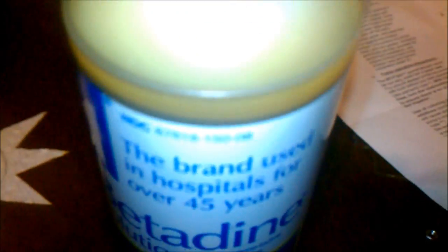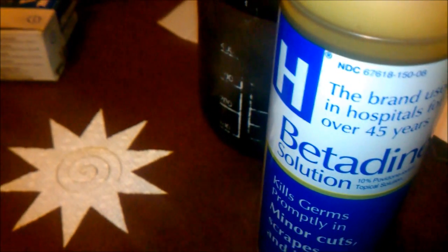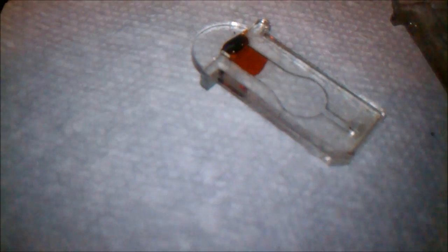I've got a disposable pipette here and some iodine solution. I don't need that much. Just need a drop, really. So I've got this, and you can see it'll wick in completely on its own.